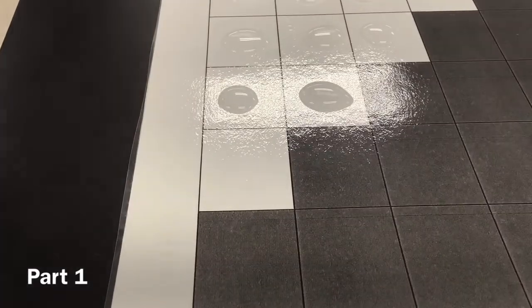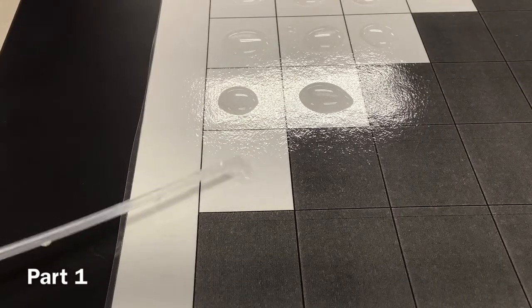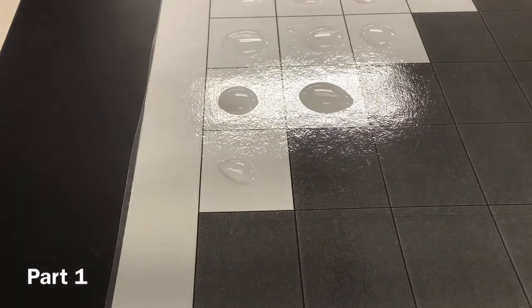CaNO3. I'm like Bill Nye, and he's the camera guy who makes it all go down. Okay, so make sure that once you're done, you flip around and write down the observations of the other group. Let's see, we're going CaNO3. Where is that one?